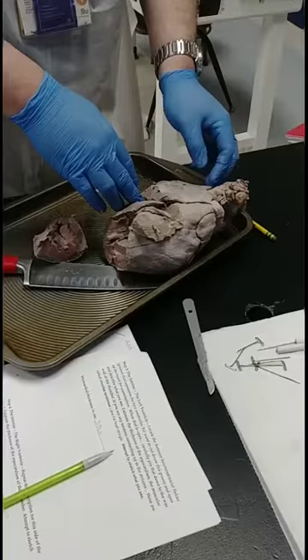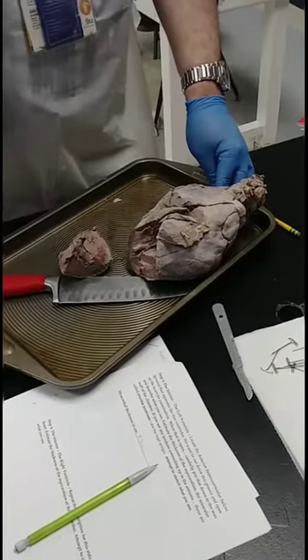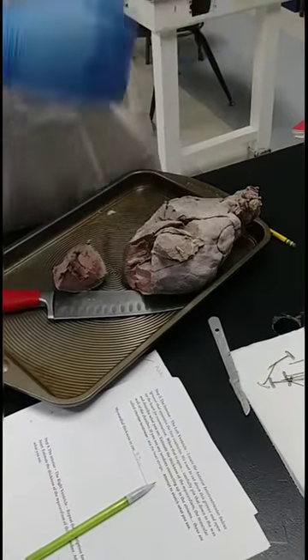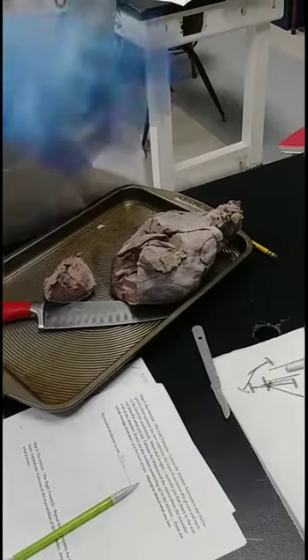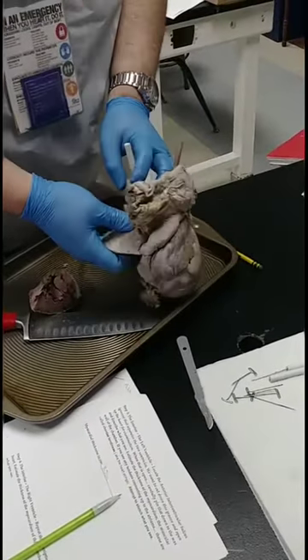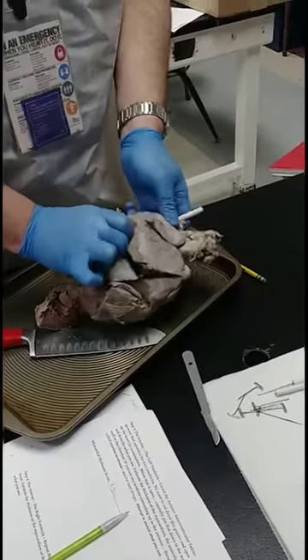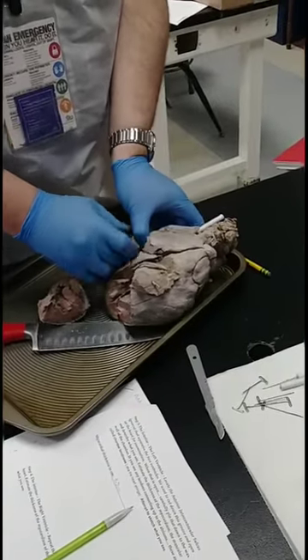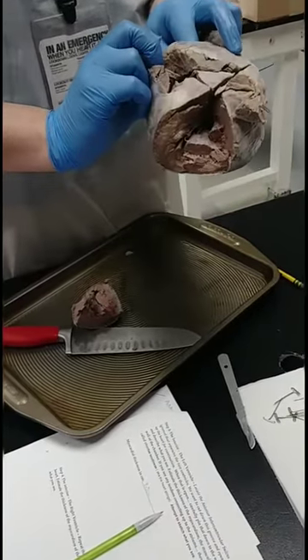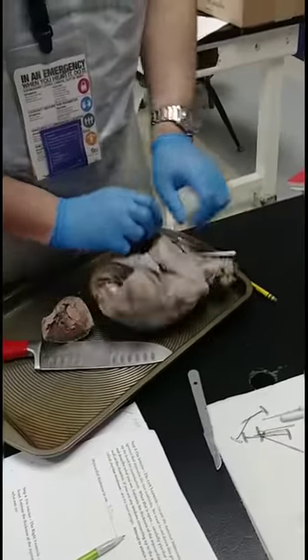We have the vena cava. The superior vena cava is on top, the inferior is on the bottom — that's for people standing upright. There's a superior one and an inferior one, but here there's no top and bottom, just sides. This is all part of the vena cavae complex. It goes to the right side of the heart. You can see where the probe is going into the right atrium.